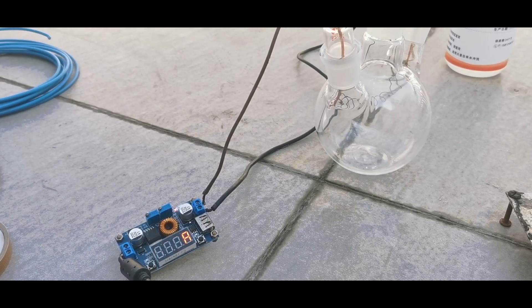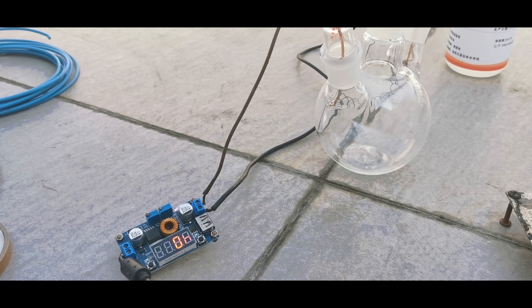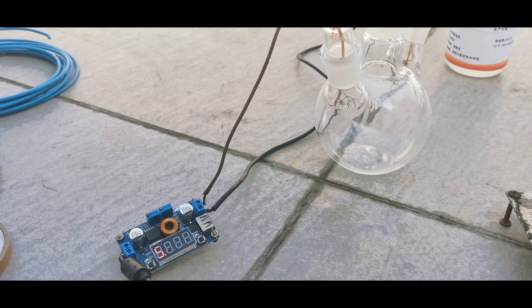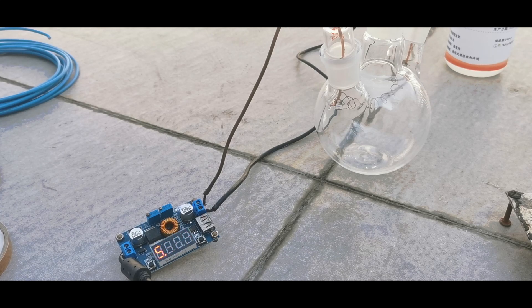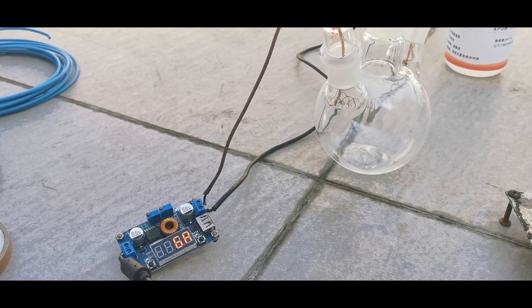I turned on the 12V power supply, and despite the current rising to 5.4A, the filament was only slightly glowing red. The pyrolysis of acetone requires temperature at 600 to 800 degrees C, so we need to get the filament red hot. The temperature of the filament depends on the current passing through it, and since I cannot apply more current using this power supply, the filament would never be red hot.